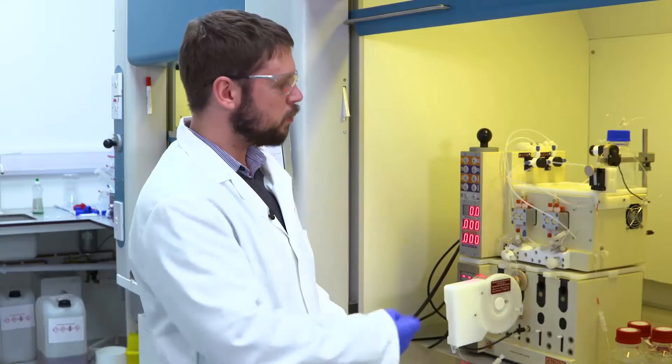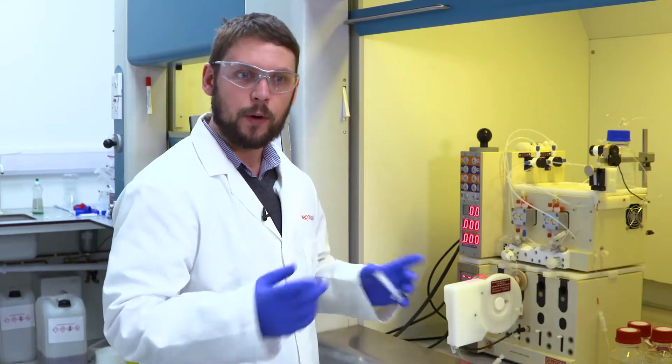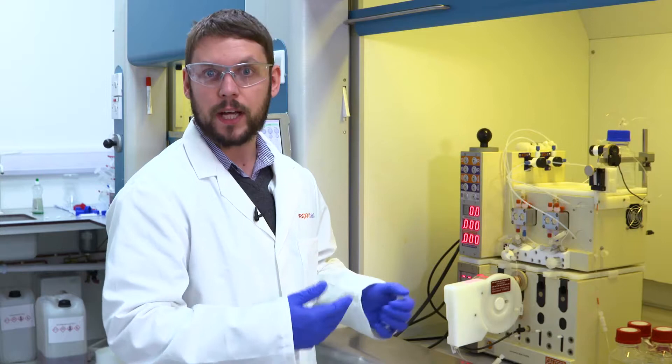The last solvent used in this pump is not miscible with the solvents that I want to use today. So because of that I need to use a bridging solvent which is miscible in the last solvent and miscible with both of the two solvents I'm using now. And that way I'll be able to switch between the two without having any pumping problems.